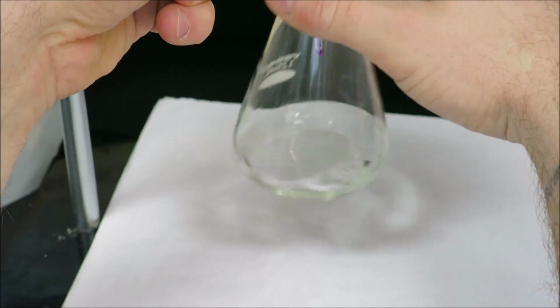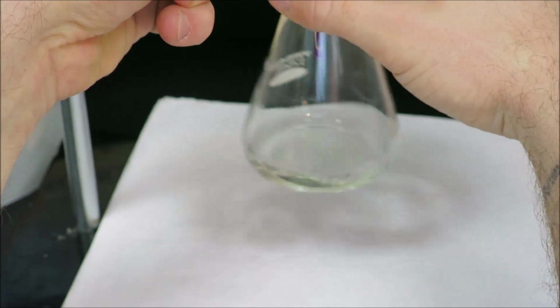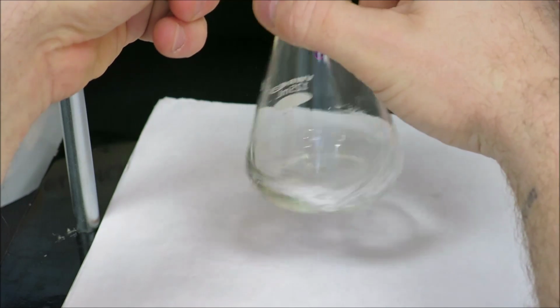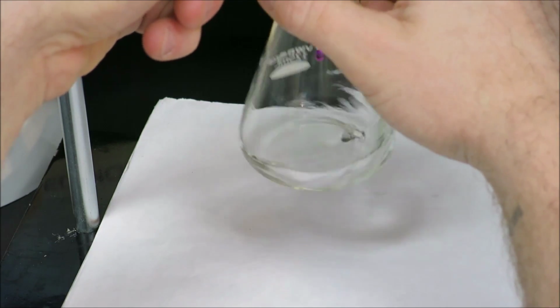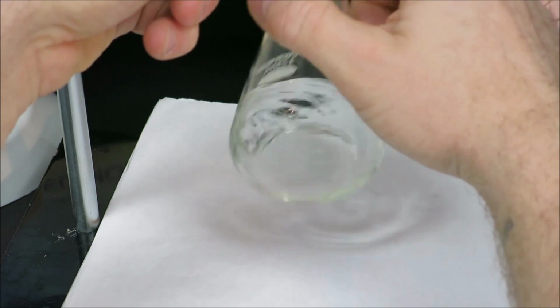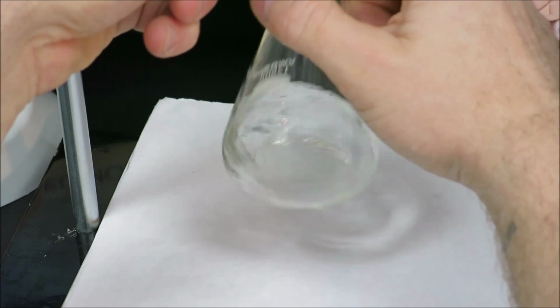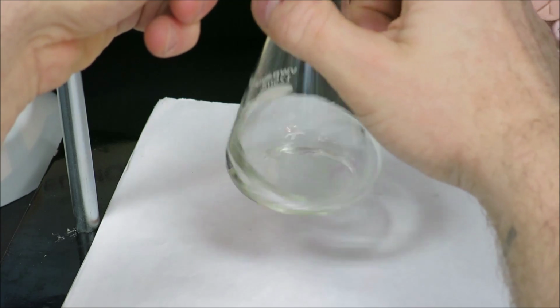such as that. And once I have my first equivalence volume, my second and third trials, or if I need more, my fourth and fifth trials, I can actually very quickly open the stopcock for most of the volume and then shut the stopcock off and drip only the last half a milliliter or so. Because this is my first trial, I have no idea what the equivalence volume will be.